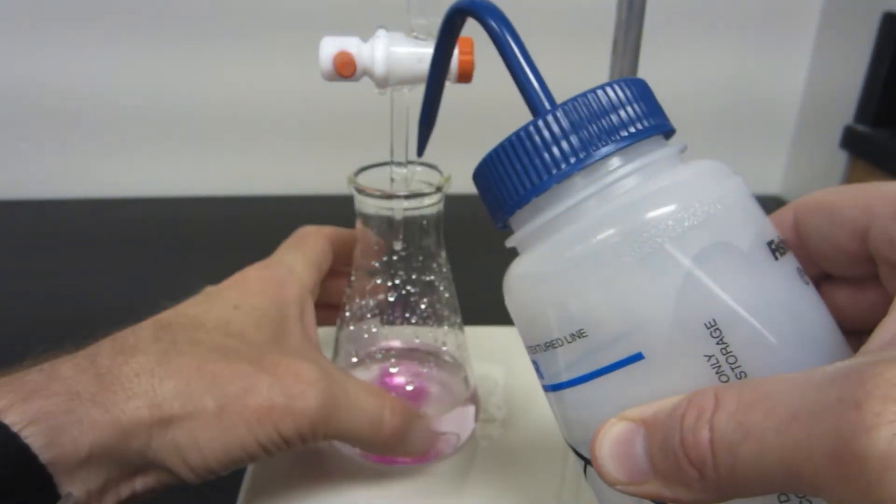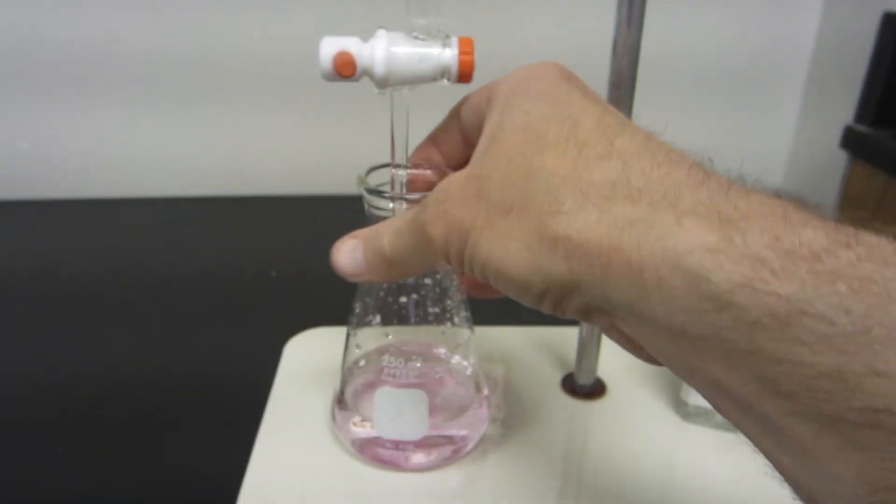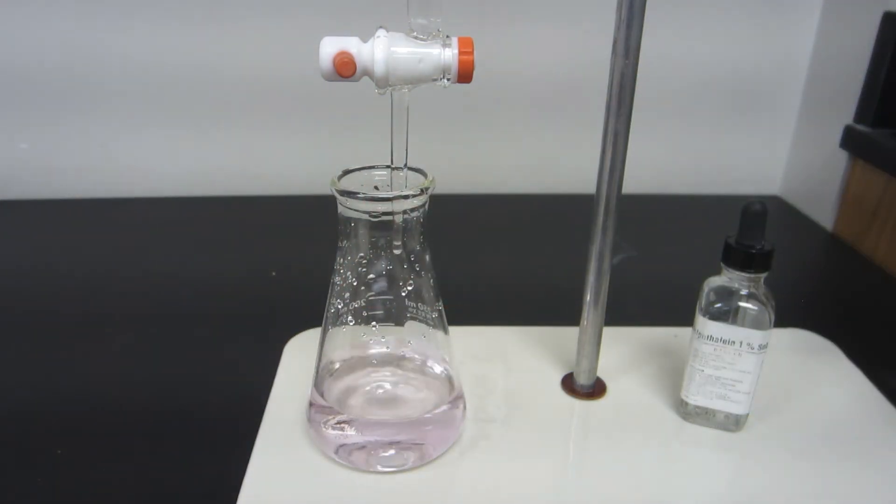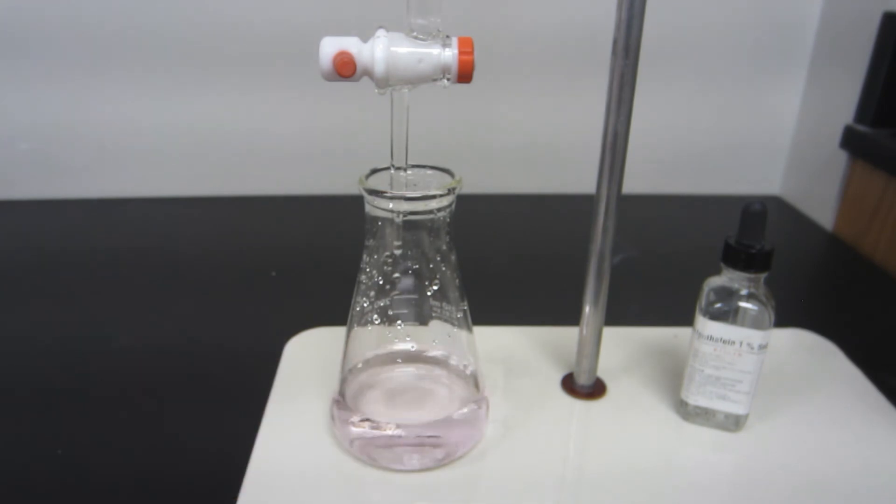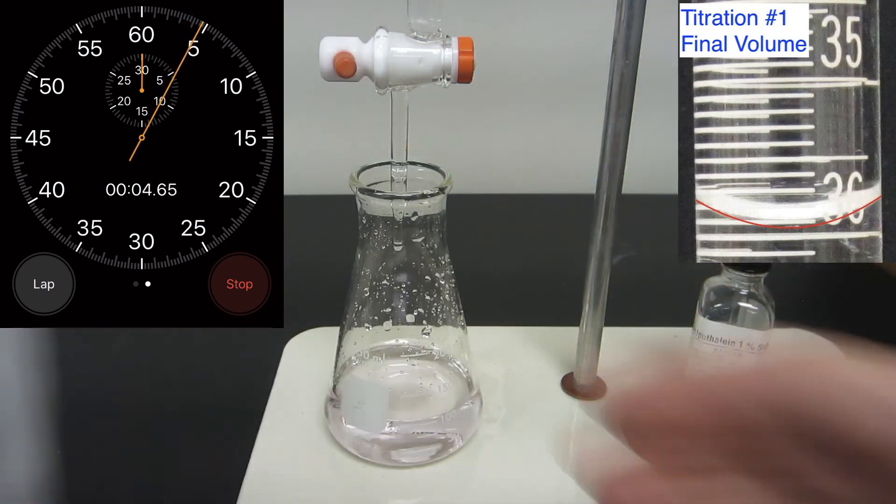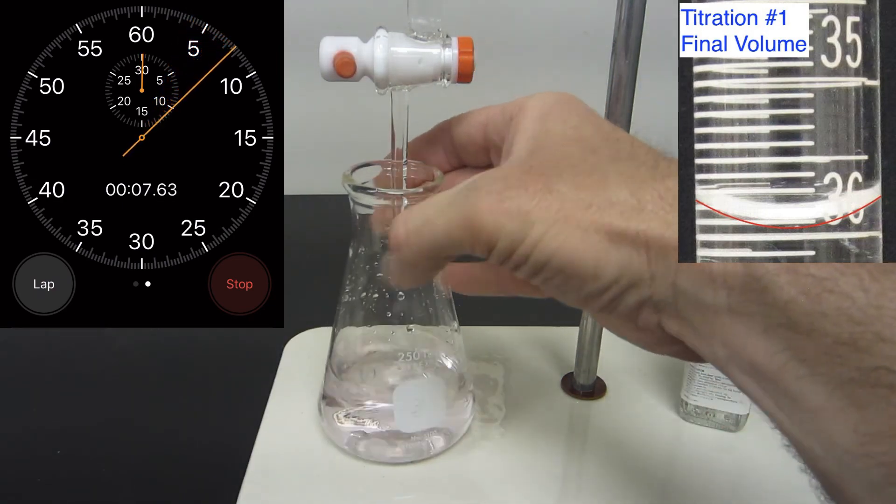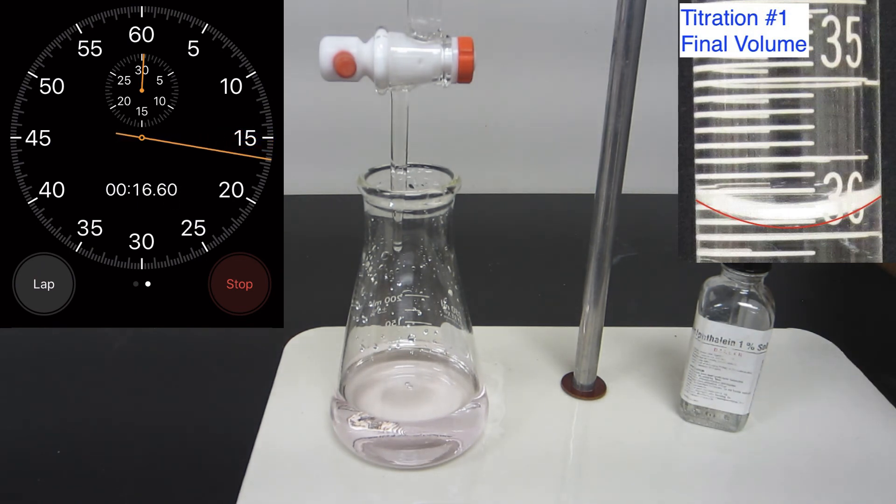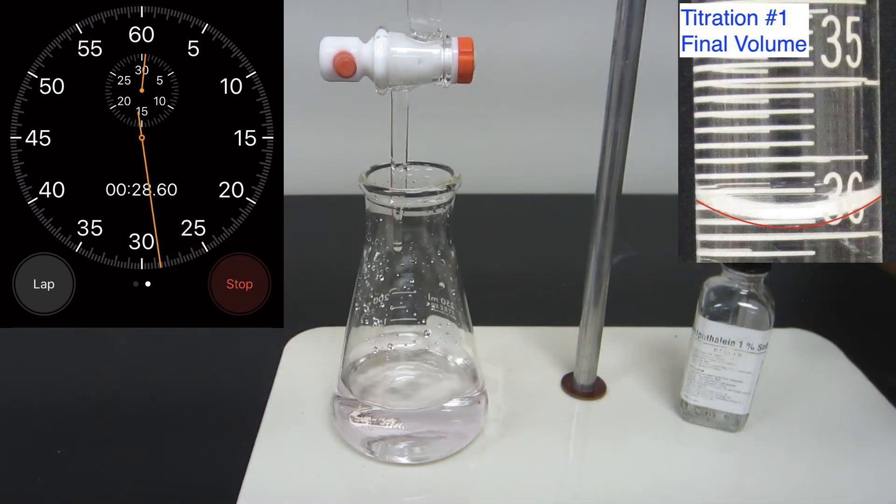Now, that solution is barely pink. That's good. That's what I want. Again, I've washed that tip off. If you notice in the video, I think you'll see that when I wash the tip off initially, it got a little bit more pink, which is good. So that pink color needs to persist for 30 seconds, usually what we say. And if it does, then we're done.